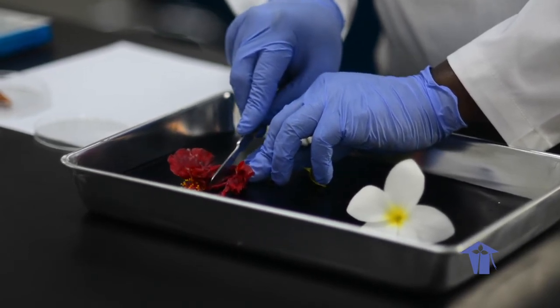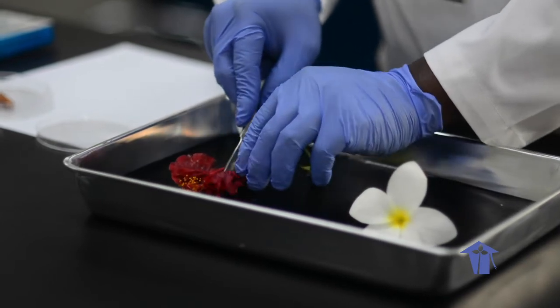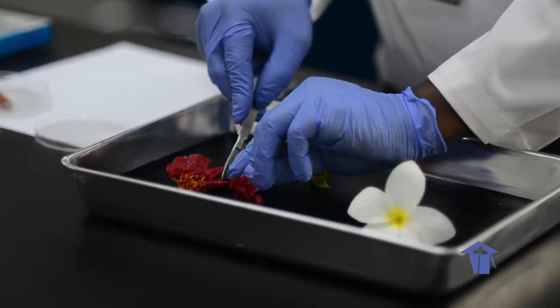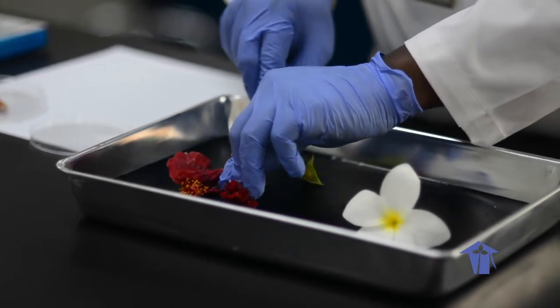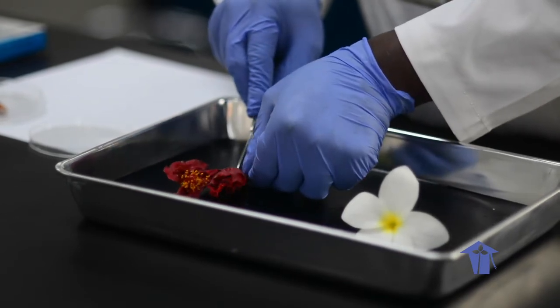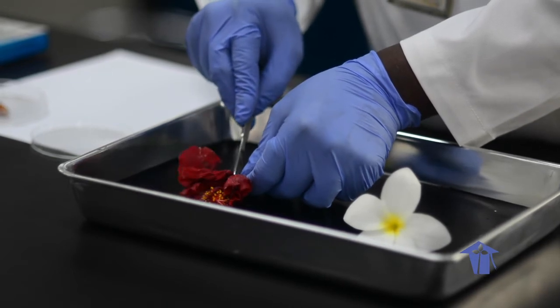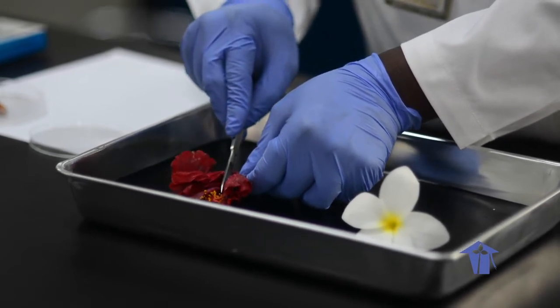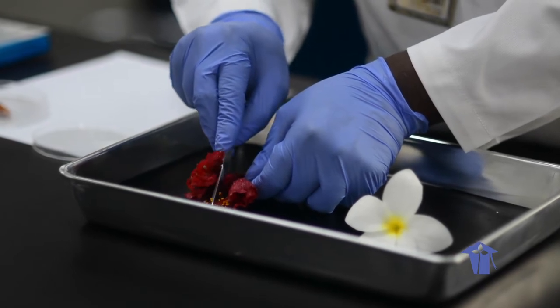along, since we're doing a longitudinal cut, a light longitudinal cut. So light cut and then separate, and then light cut and then separate. All right. So try not to do a heavy cut throughout. Now, so light cut all the way up.